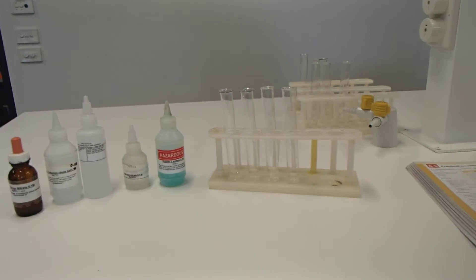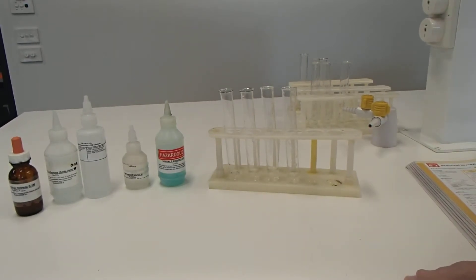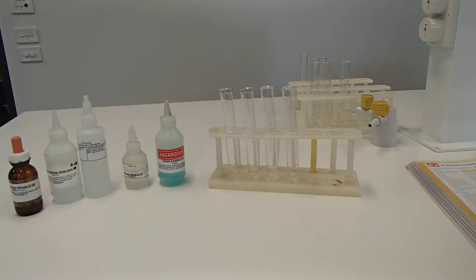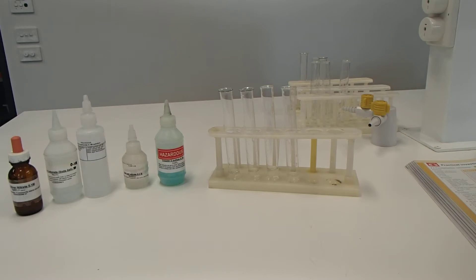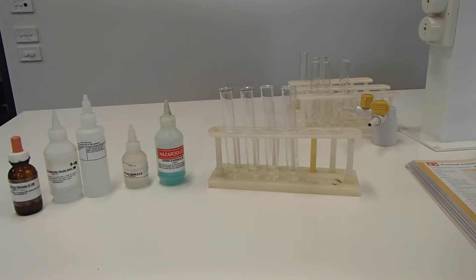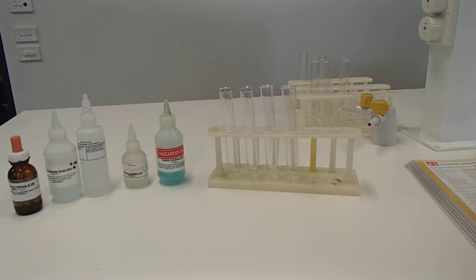So today of course we're seeing if substances, when they're mixed together, are soluble or insoluble. We call the solid that is made when two solutions are mixed together a precipitate, remember. That's a solid. And what we're looking for is a colour change or cloudiness or floaties, bits and pieces that are there to show that a solid has been made. And you can see at the start that all these solutions will be clear and then they may perhaps go cloudy or colour change indicating that a solid has been formed and a precipitate has been formed. So we call this a precipitation reaction.